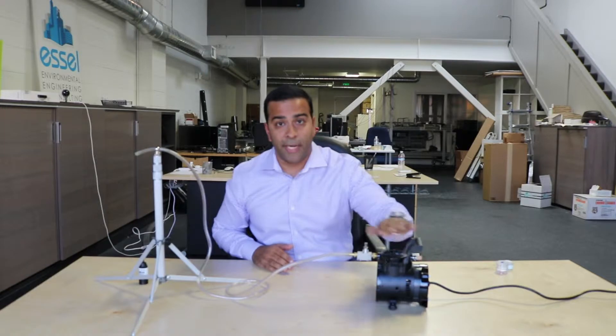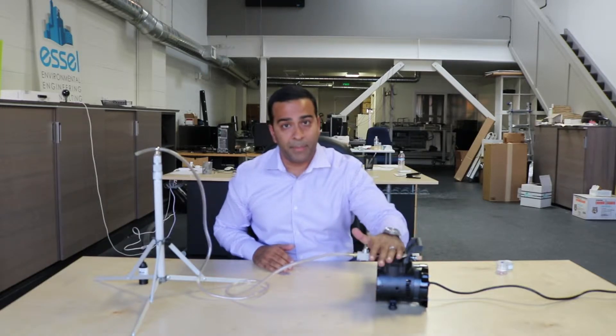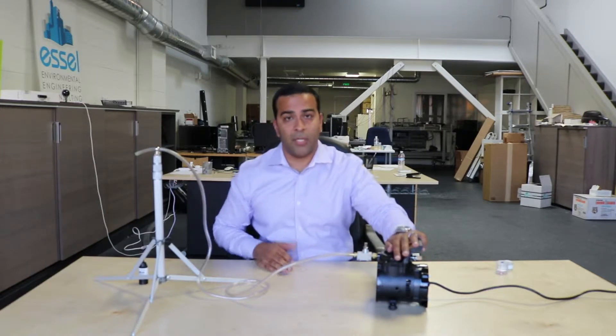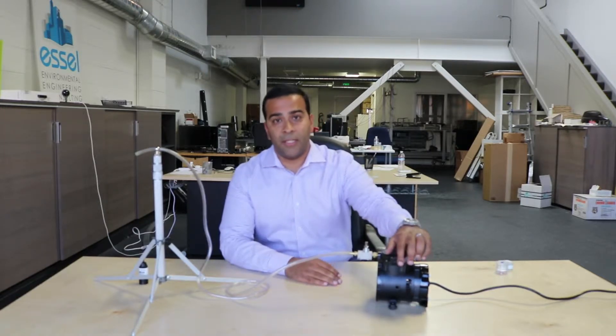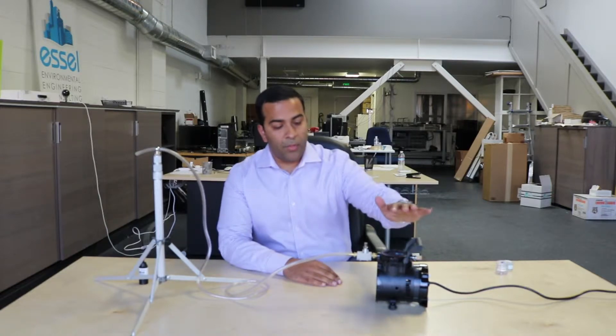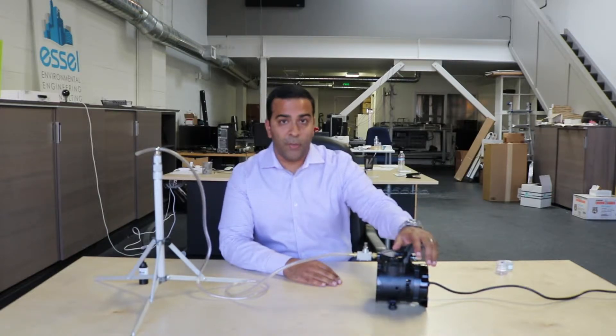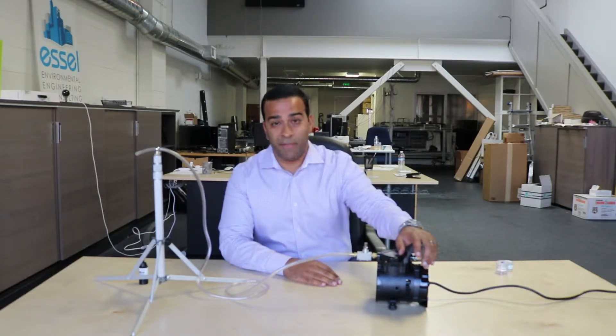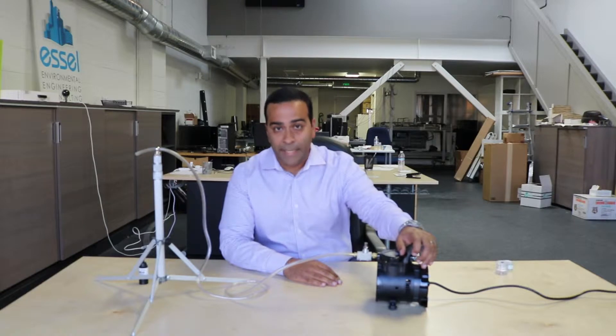What you've got is your air sampling pump. This is a high volume pump, which is generally what you're going to want to make sure that your consultants use. By high volume, it basically means it goes up to 15 to 25 liters per minute.